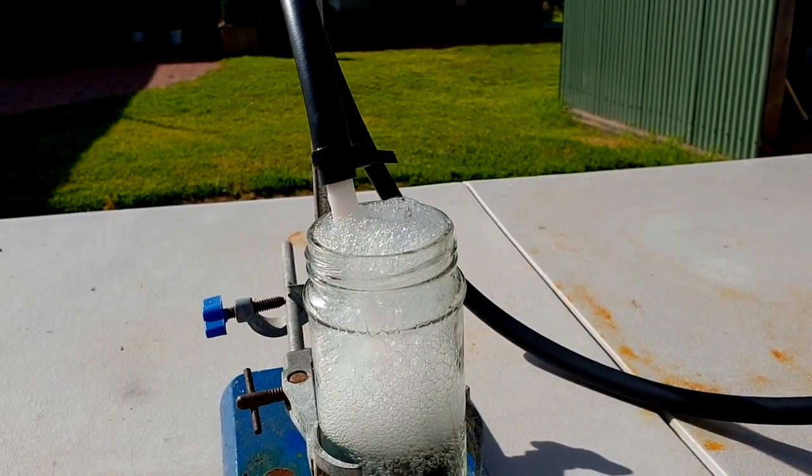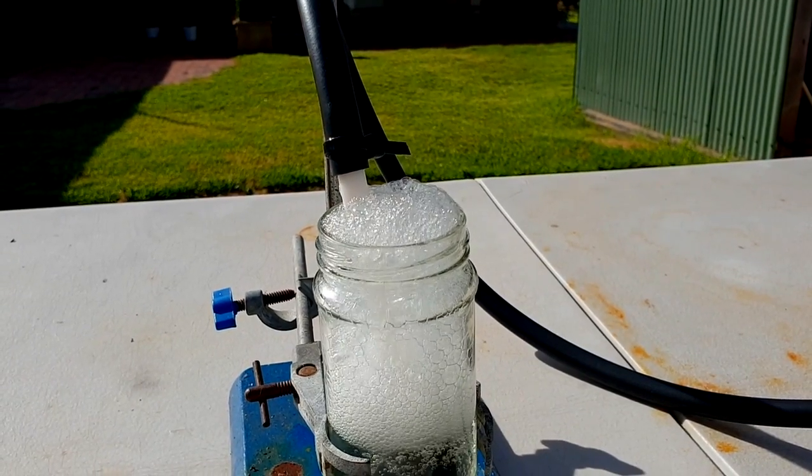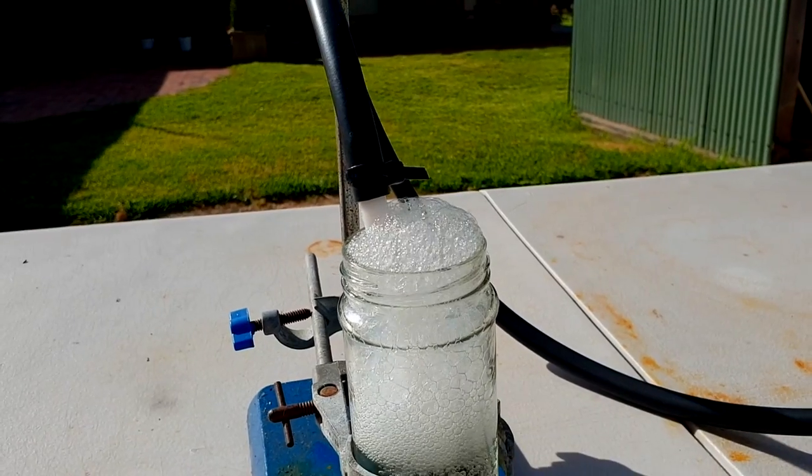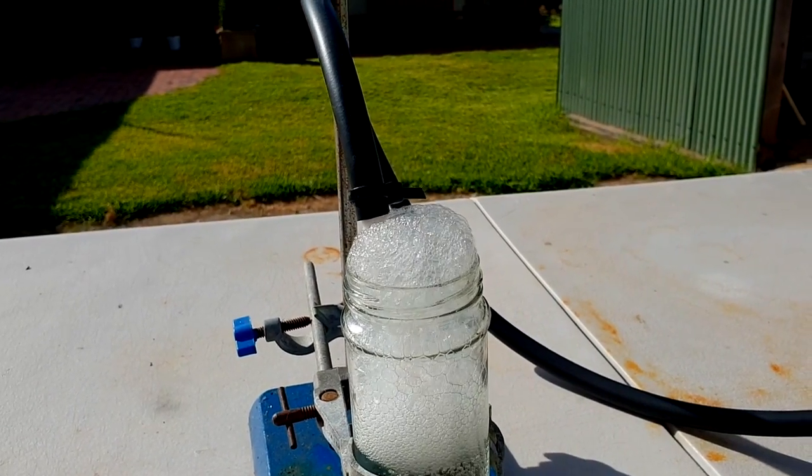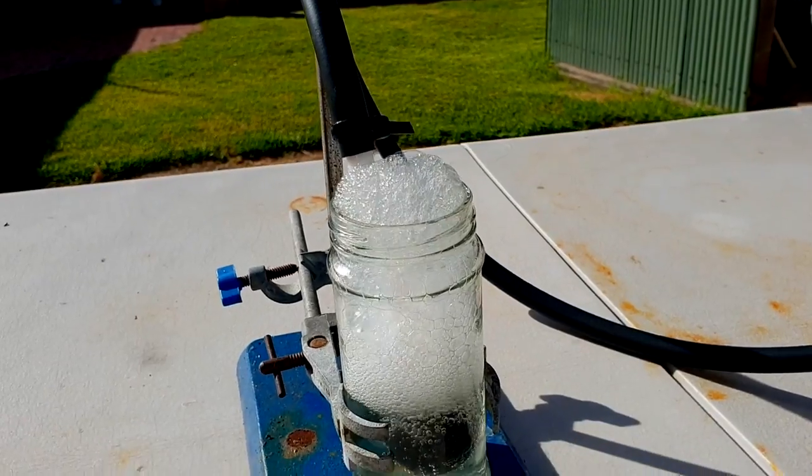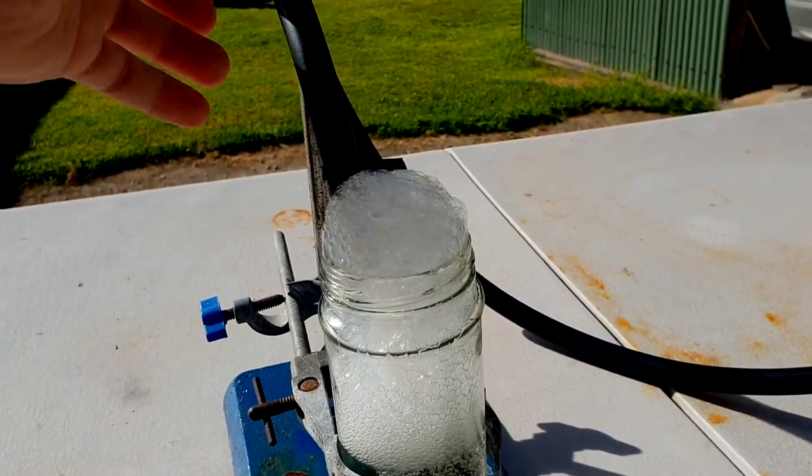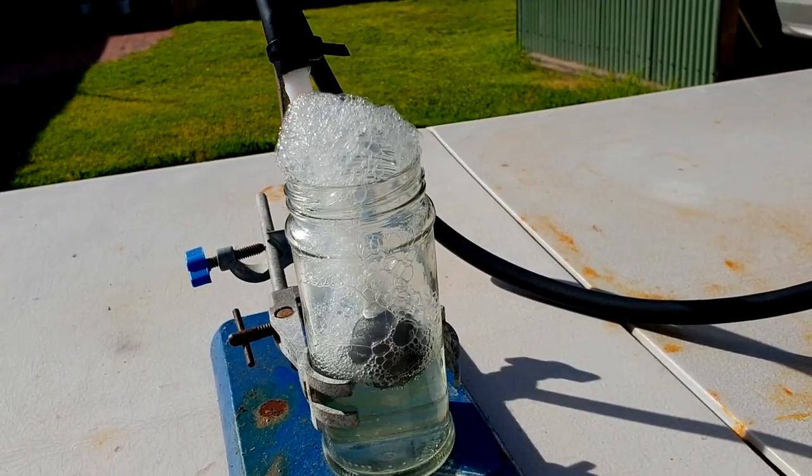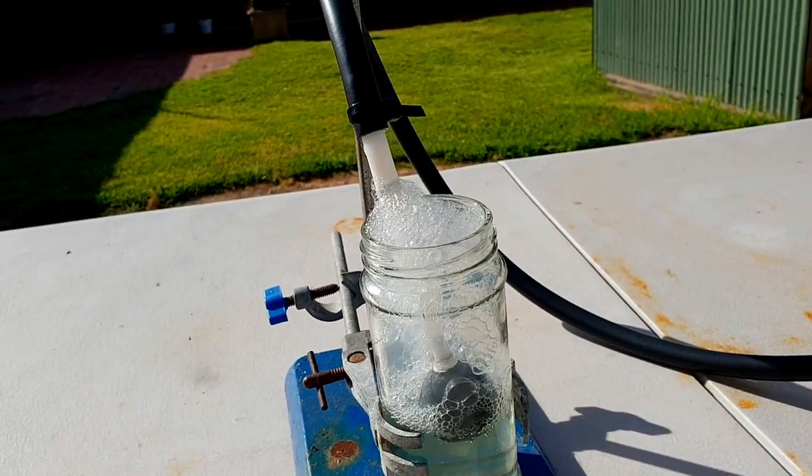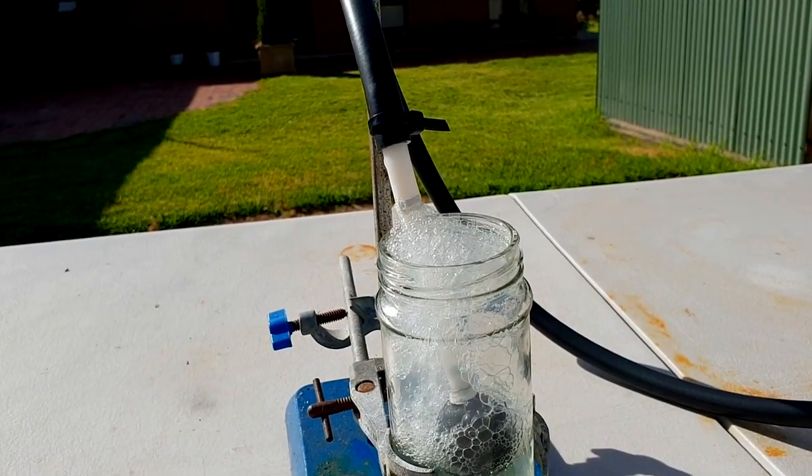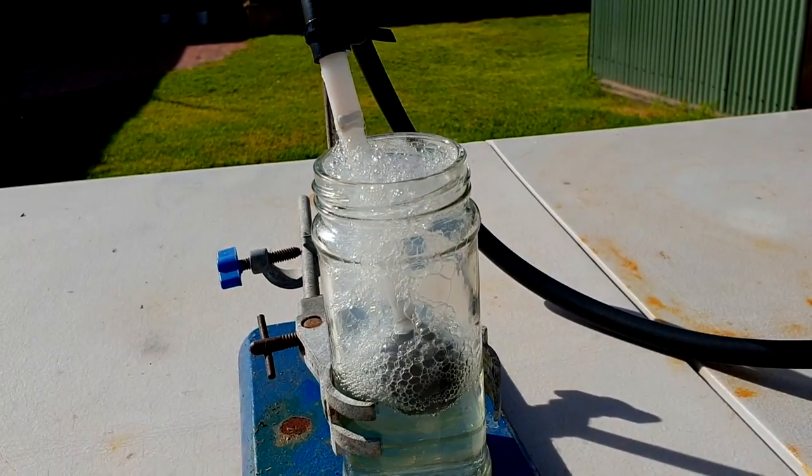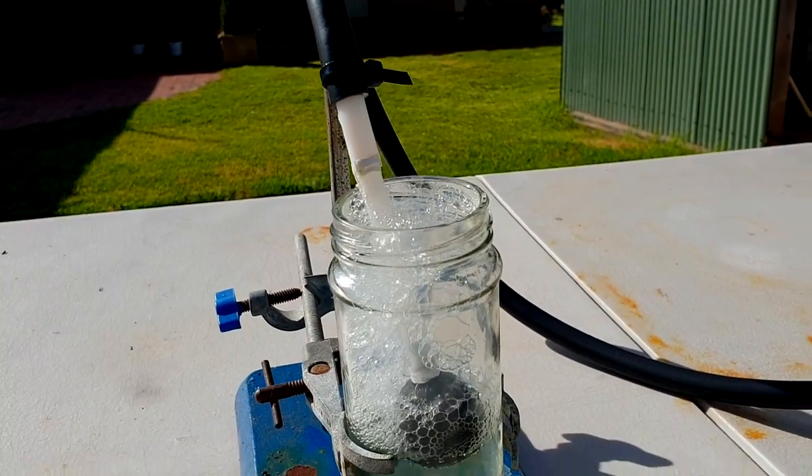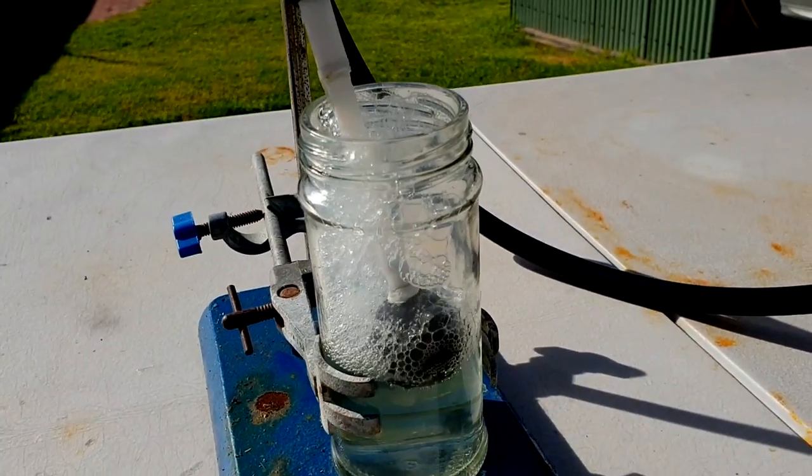What's interesting is that occasionally when there's a big bubble burst, you can see a little bit of a cloud of white smoke come off it. I don't really know what that is. It's easy to say, oh, it's ammonia, but why would ammonia look like that? I think it might be a dust of ammonium nitrate. Like ammonium nitrate in a very small concentration would pull water from the air and create this kind of smoke cloudy effect. So, signs that it's working, although how much of that we're actually capturing? It could obviously just be the ammonia gas coming out of solution, looking cloudy.